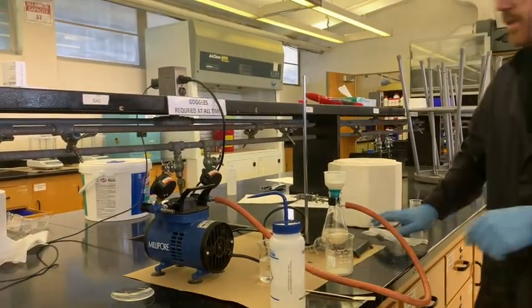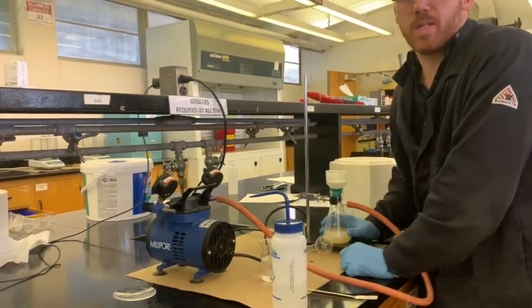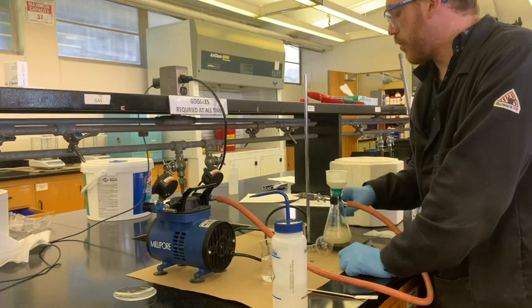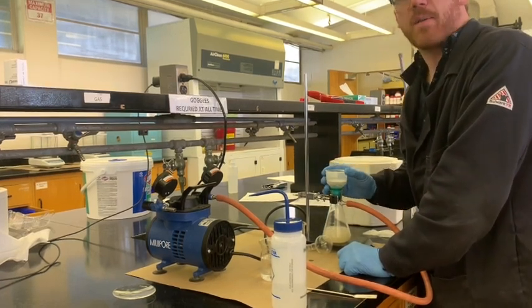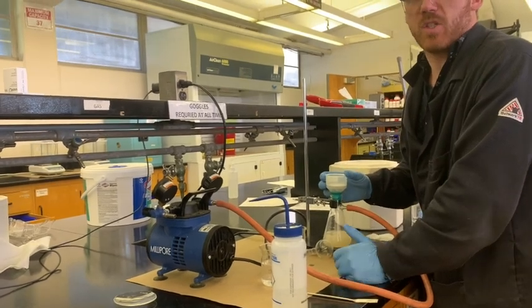So for today we're just going to call it. Some of the stuff down here might also be impurities that we don't want, and so we're going to try to keep as much of the product on the top as we can and not worry too much more about what the yields can be. It'll just work out.